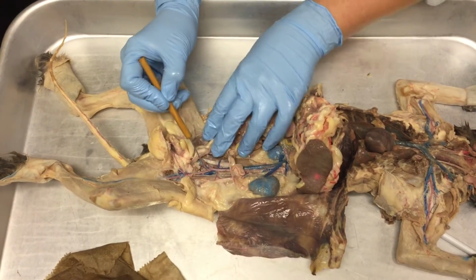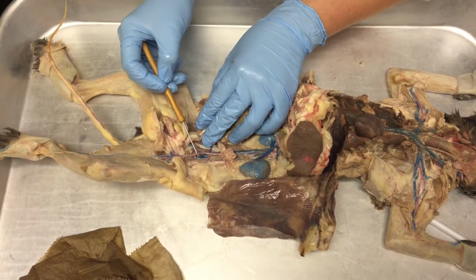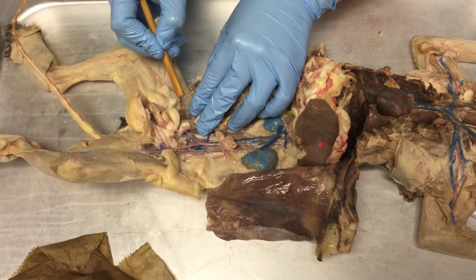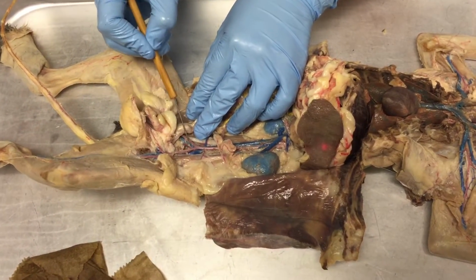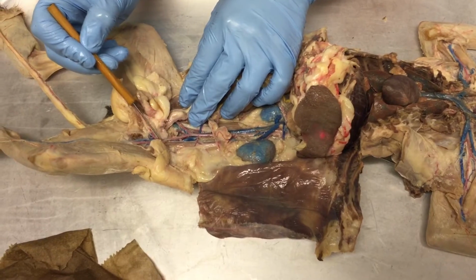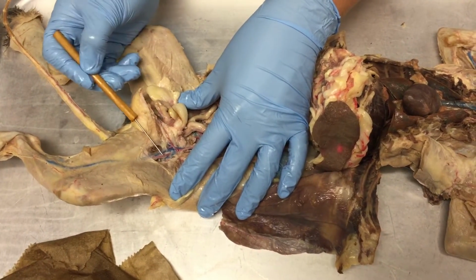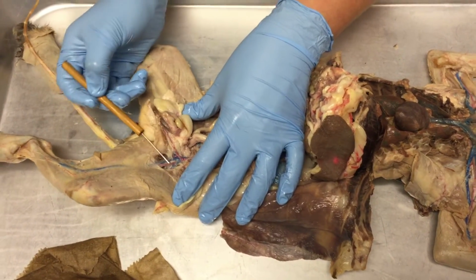Okay, the outer V, these are the external iliac arteries. So this would be the left external iliac artery. This would be the right external iliac artery. Okay, so the outer V are the external iliacs. Left external, right external. When the external iliac enters into the leg, it's now called the femoral because it's going to split off. See how it splits right here? This is now called the femoral.